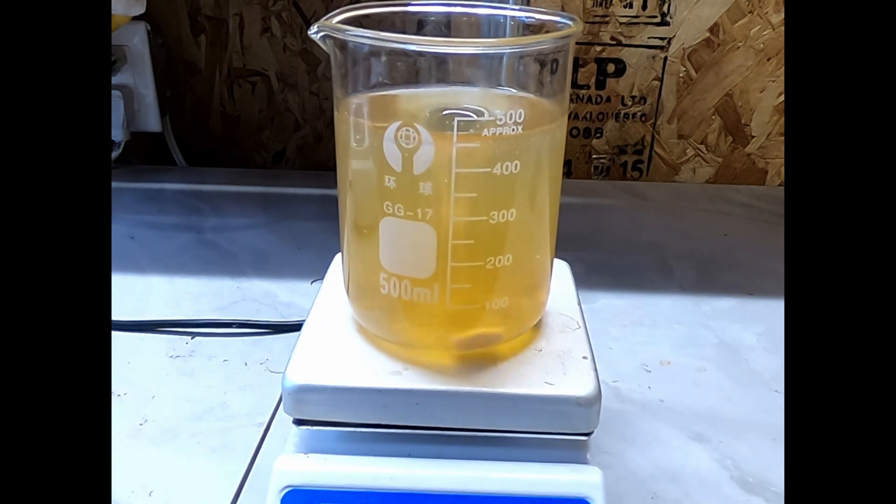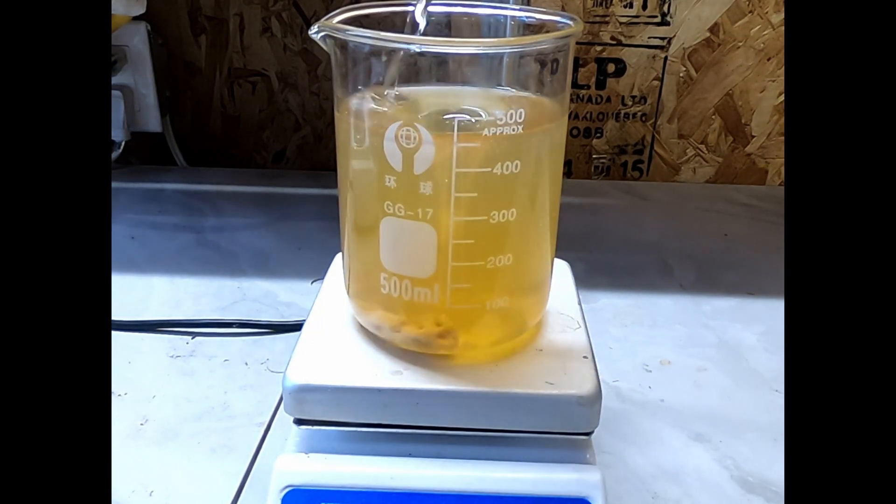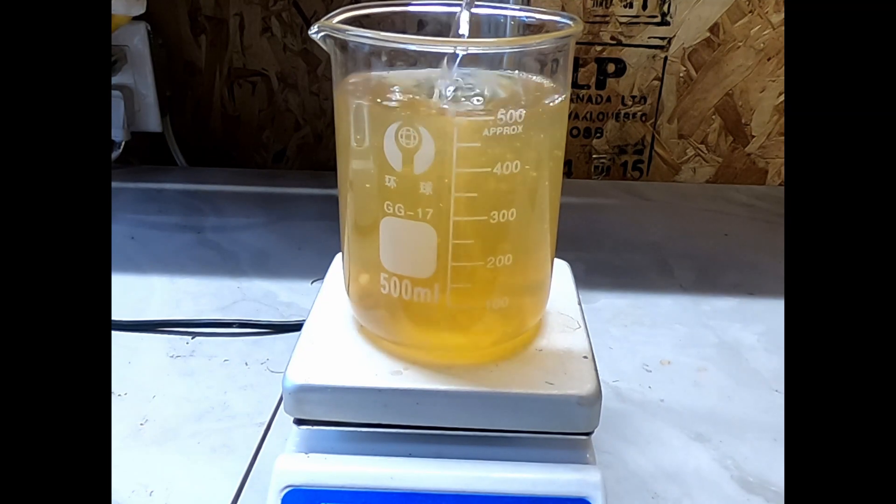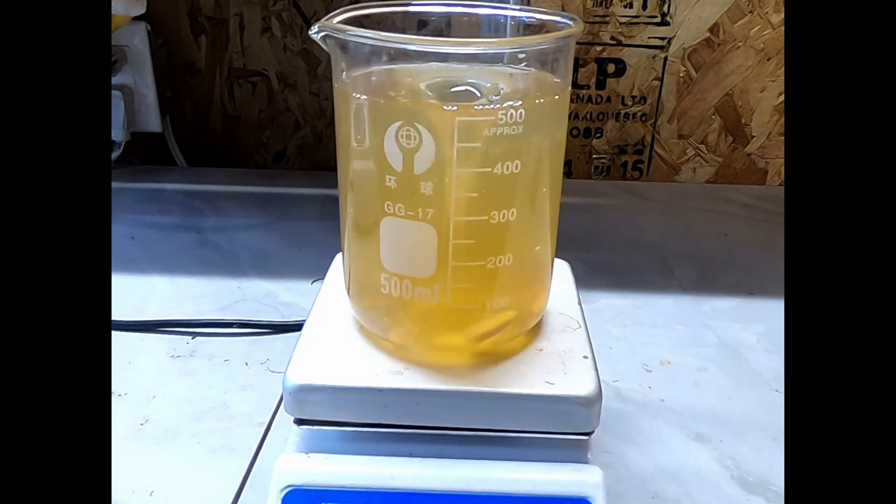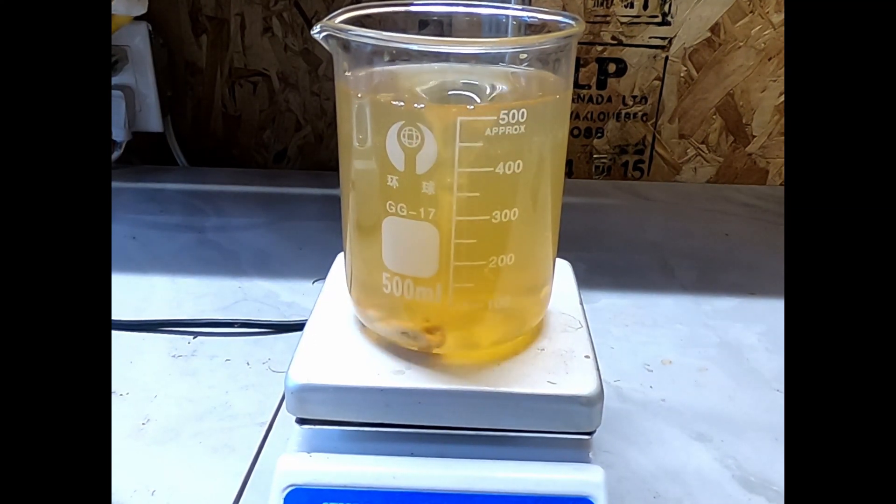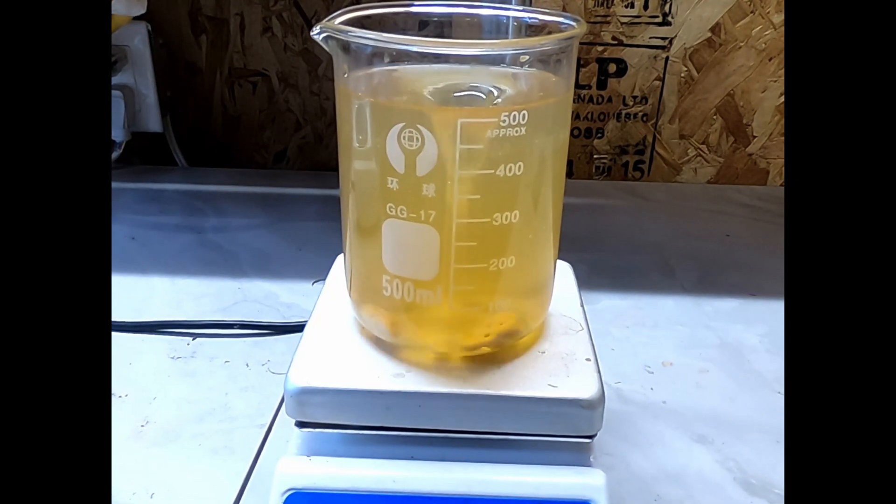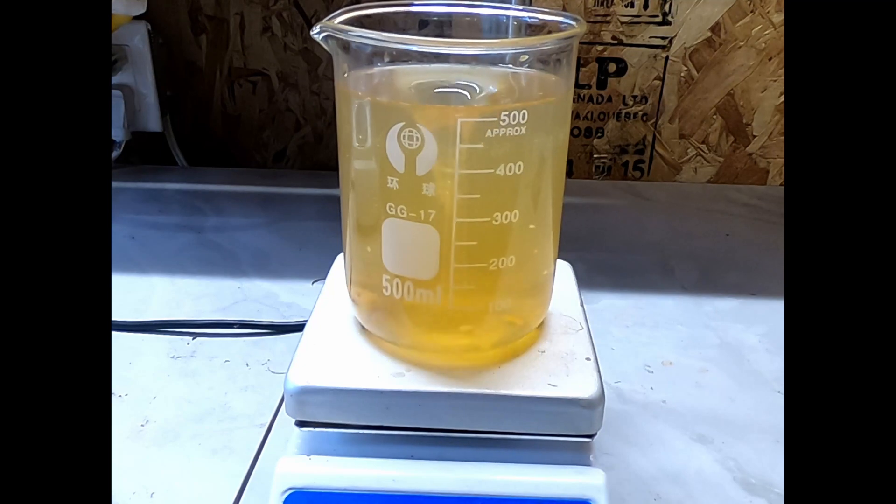In this video I'll be demonstrating how to recrystallize sodium carbonate. This is a pretty simple demonstration, but I made a big mistake that will serve as a demonstration of what not to do if you decide to try this on your own. I'm doing this because I need it for a later video about caffeine extraction.